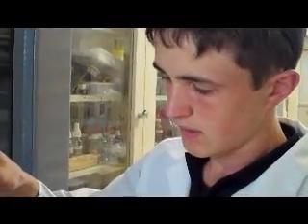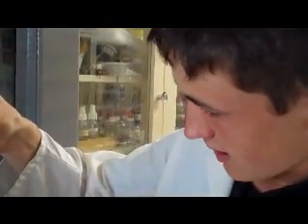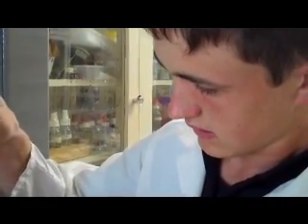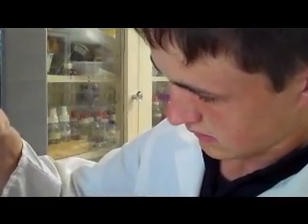What's happening this time, Chris? We've got an endothermic reaction this time. How do you know? It started at 22 degrees and it's currently 18 degrees and still falling. Okay, so it's dropped by 3 degrees and still going. Very good. We've got an endothermic reaction when we mix water and potassium nitrate.